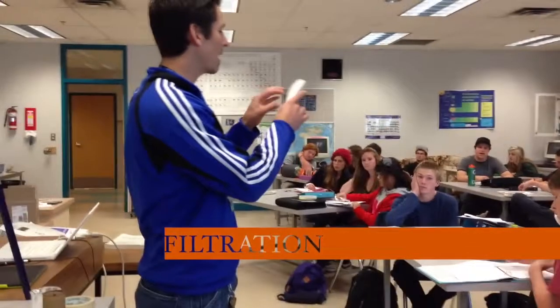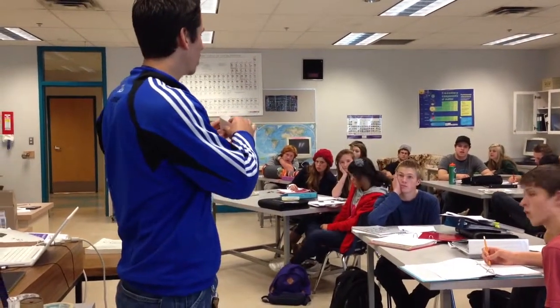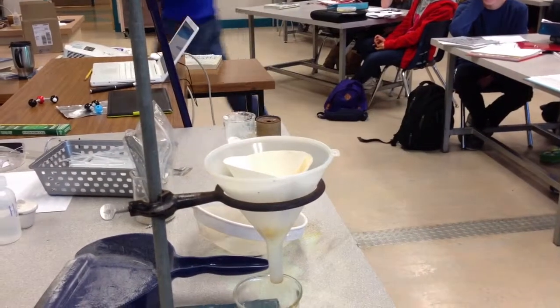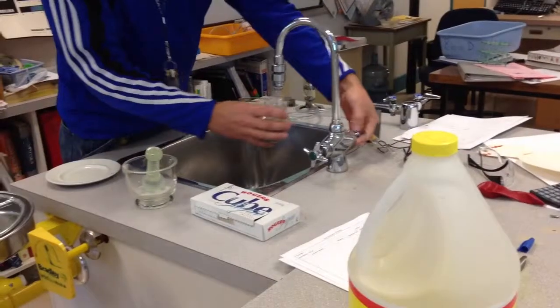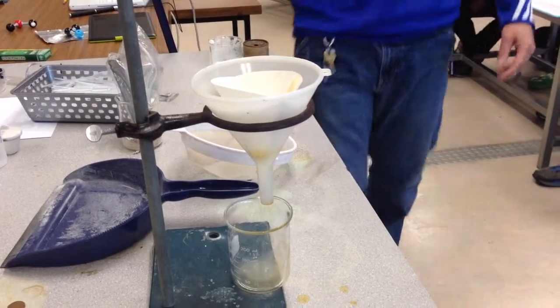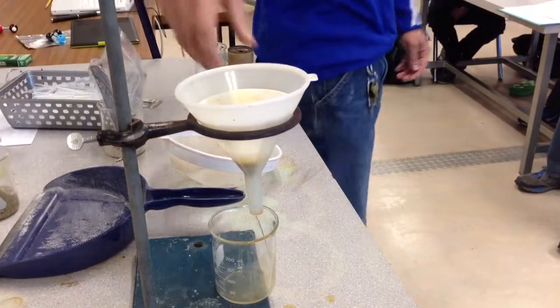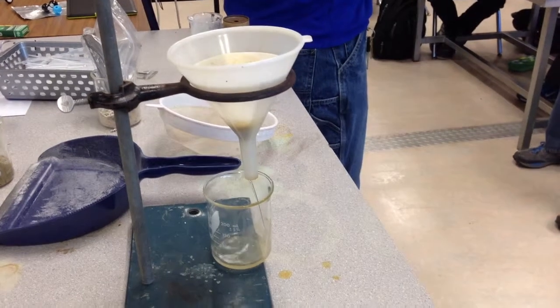Okay, you take a round piece, fold in half again, and then you open it up. You've got a nice little cone that stuff can get through. Pop it in here, and I'm going to this time use, again, sand and gravel, but a bit of water as well. Okay? And it doesn't like to stay mixed, so I'm going to have to keep on swirling it around. I'll drop a bit of that in there. And what's coming through the bottom? See any rocks coming through the bottom?